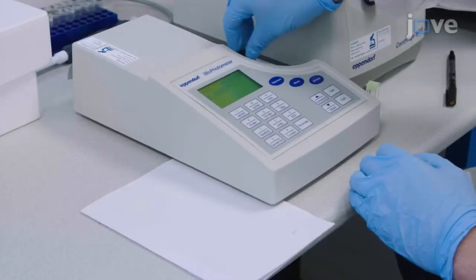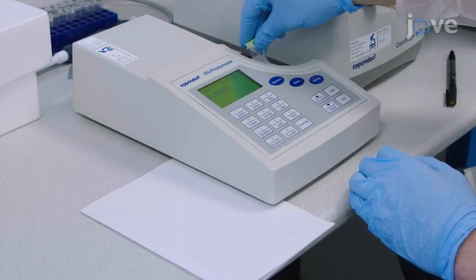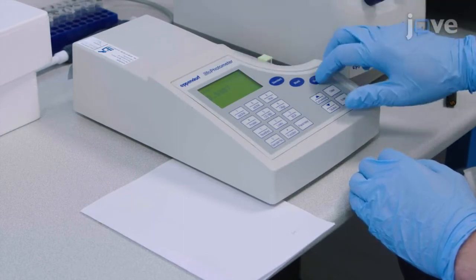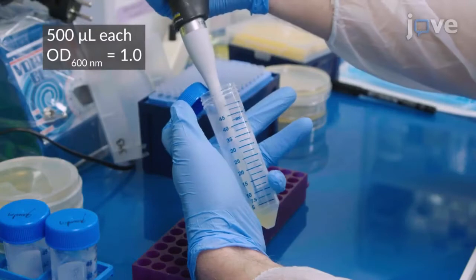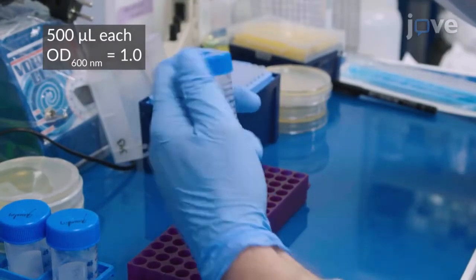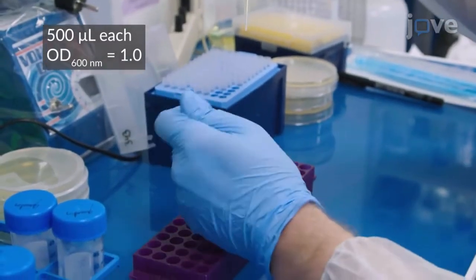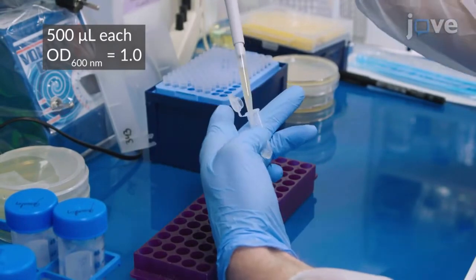On the next day, measure the optical density of the cultures, and mix an equal quantity of P. aeruginosa, E. coli Top 10, and E. coli helper in a 1.5 milliliter microtube.